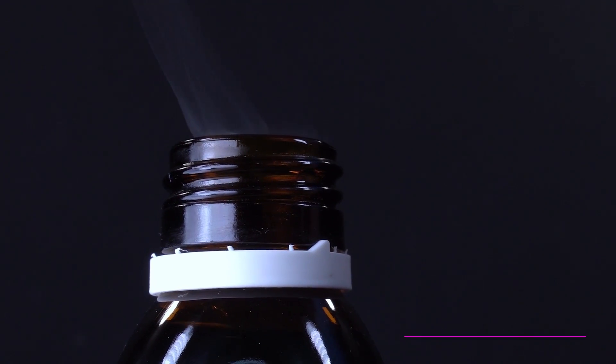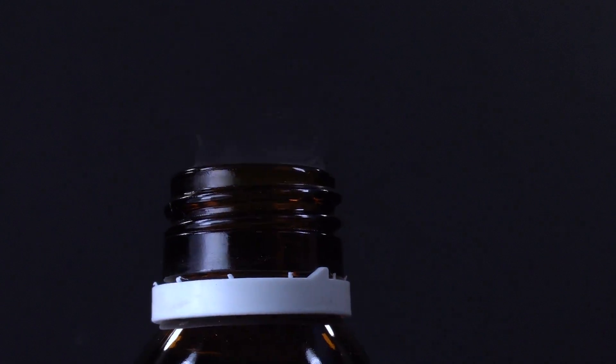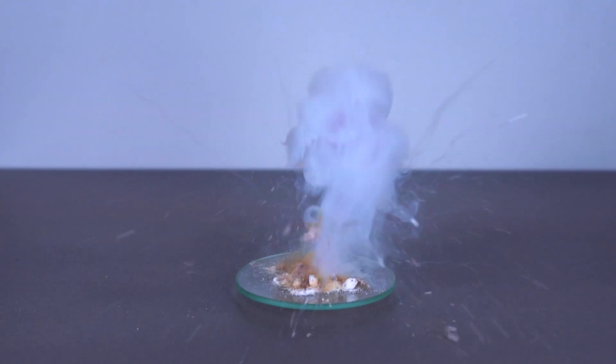Knowing how violent hydrazine hydrate reacts with different oxidizers, I tried to drip some hydrazine hydrate on iodine pentoxide.